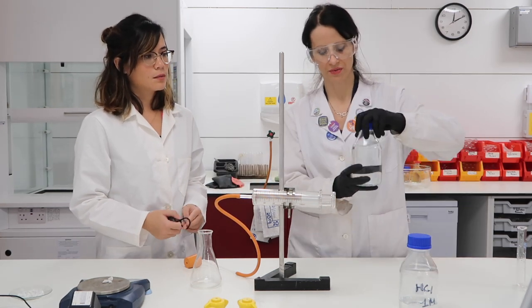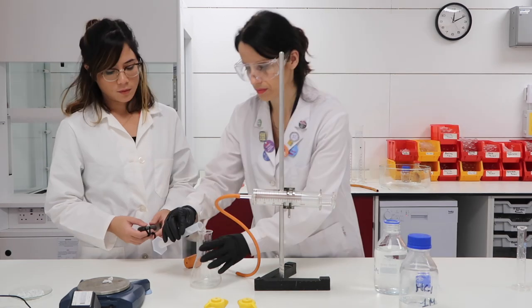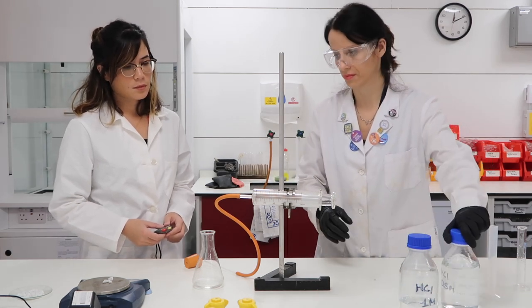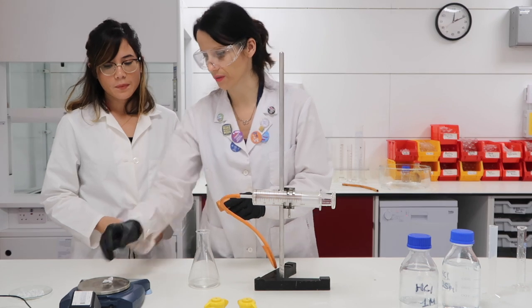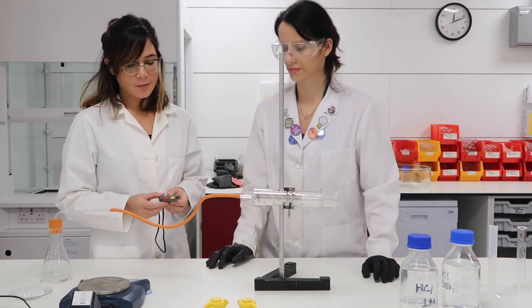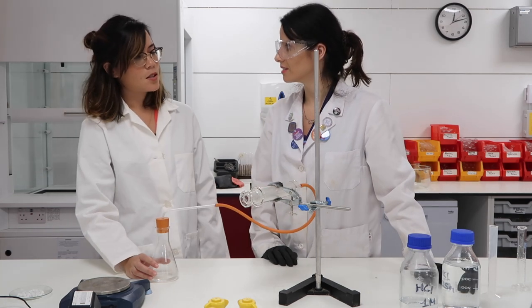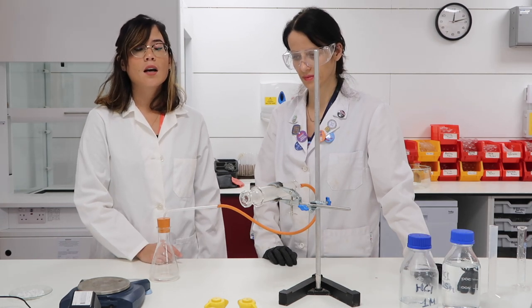I'm going to measure 25 cubic centimetres of hydrochloric acid. Now we're going to add the marble chips — that's one gram, they weigh one gram. So immediately they'll start reacting; make sure you start the stop clock immediately once the bung has been replaced. We'll measure the volume of gas produced in 30 seconds. 10 — okay, 10 centimetres cubed. So we produced 10 centimetres cubed of carbon dioxide in 30 seconds, and now we need to compare by repeating the same experiment but using a lower concentration of hydrochloric acid.